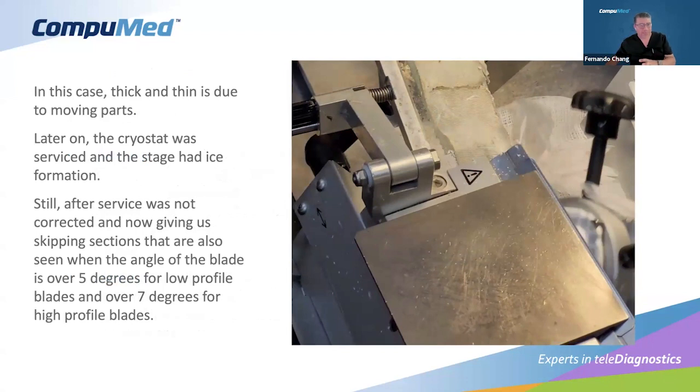It has to be the equipment. It's not the technician. It's not the sample itself. We need to figure out that something is wrong. And then we called service again. And what happened is that this plate, the plate that we have here in many cryostats, has a rod that goes all the way down. But this rod keeps the blade secure.